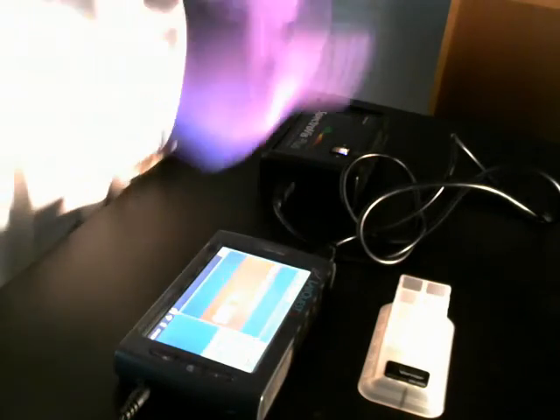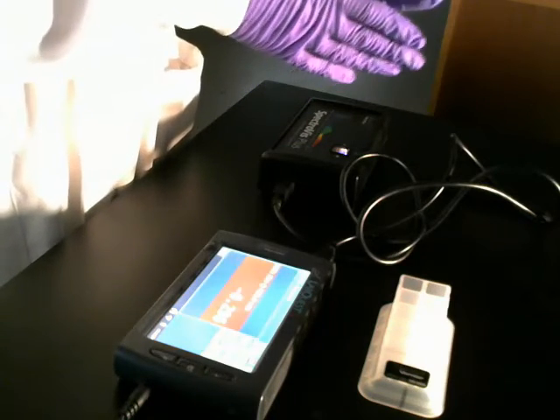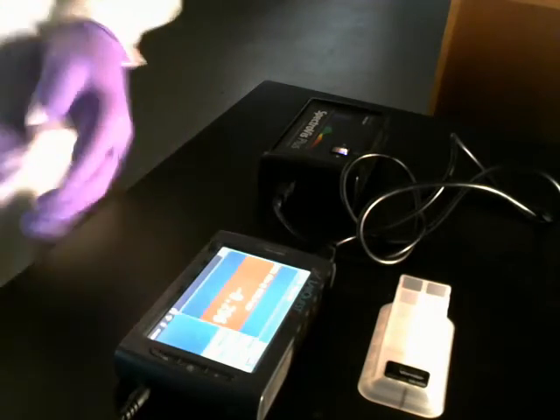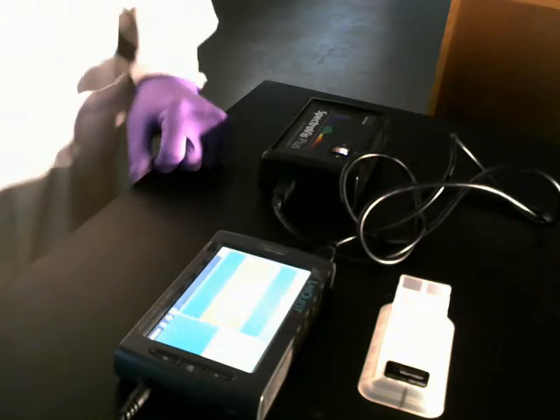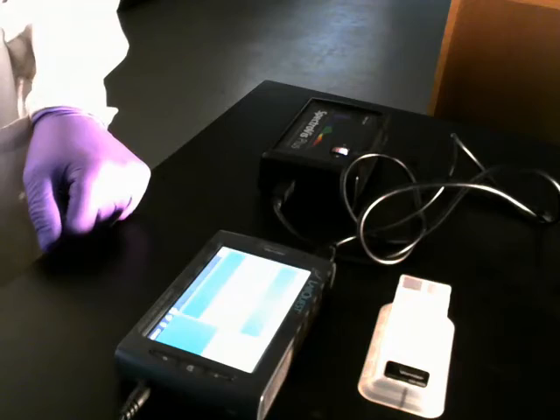So now every time I take a reading, I'm going to go in the same order. Start with my dark control, then my no chloroplast, then my 30 centimeters, 60 centimeter, and 90 centimeter. And by doing that all in the same order, they should all be about 5 minutes apart. I've got about 1 more minute before I take my next reading. Reading every 5 minutes.